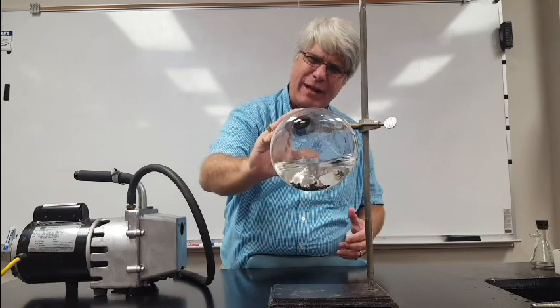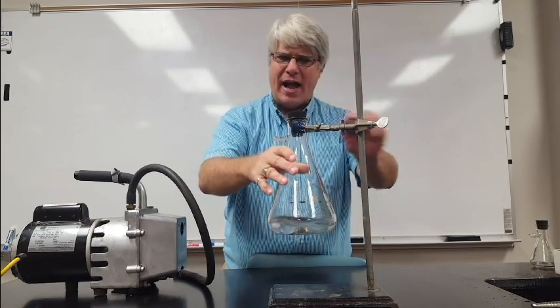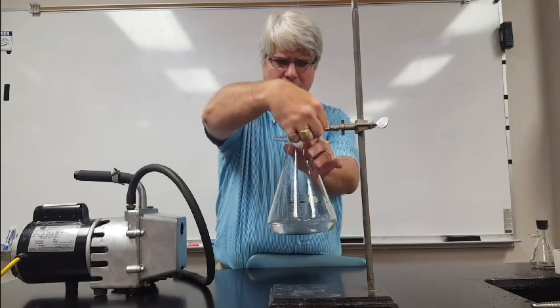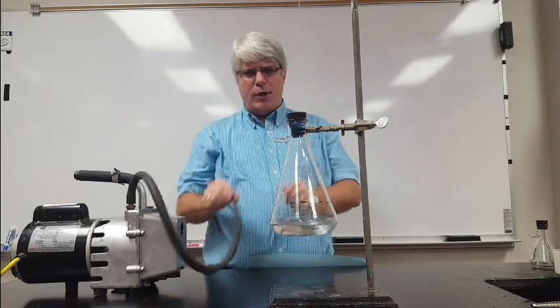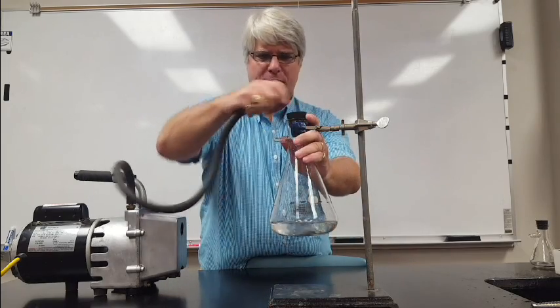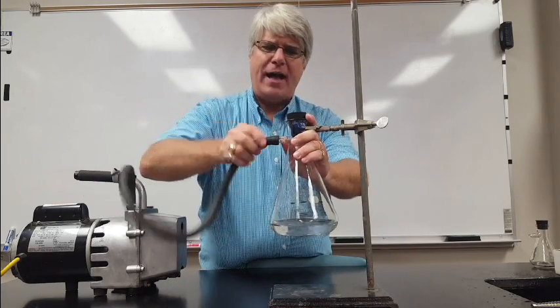They're little black tiny rocks and you'll see why I have boiling chips in there in a minute. But in any event, this is a liquid at room temperature. As you can see, it's a liquid. And what I'm going to do is hook this stoppered flask up to a vacuum pump.